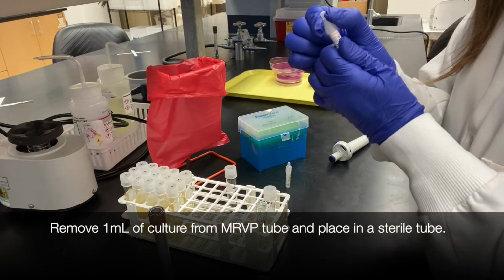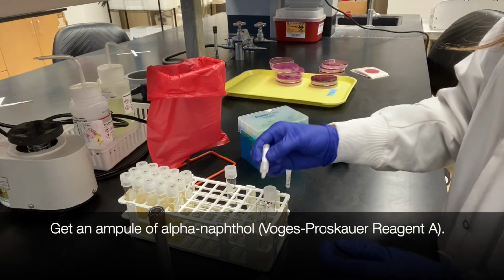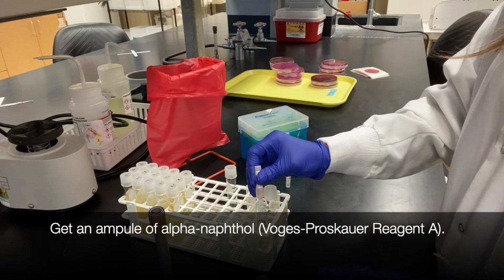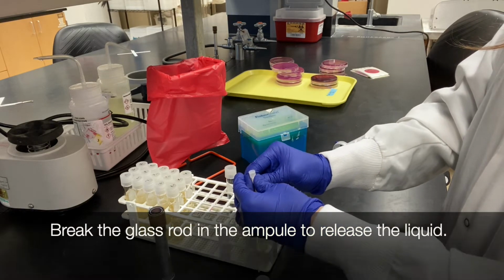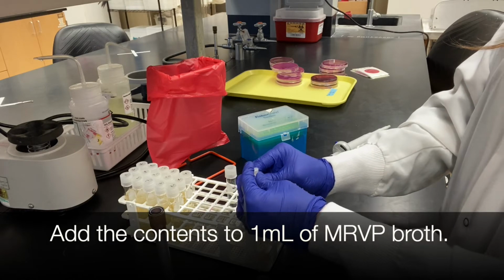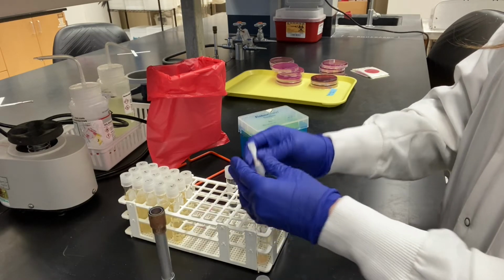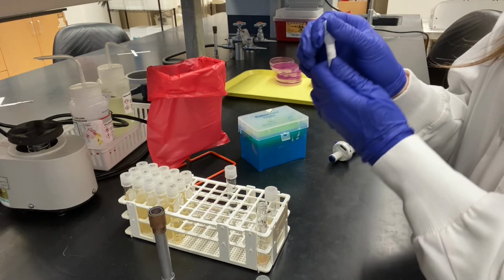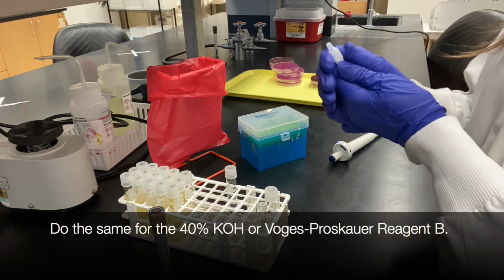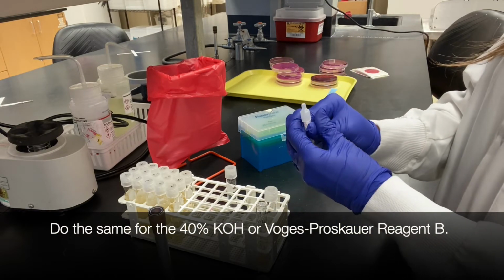Remove 1 ml of culture from your MRVP tube and place it in a sterile tube. Get an ampule of alpha-naphthol or Voges-Proskauer reagent A. Break the glass rod in the ampule to release the liquid. Add the contents to the 1 ml broth. Do the same for the 40% KOH or Voges-Proskauer reagent B.